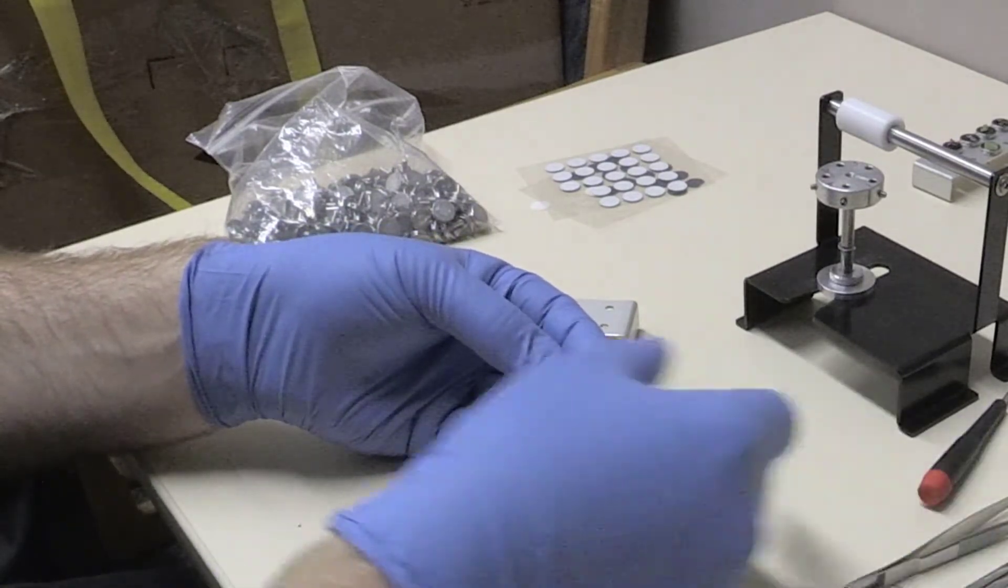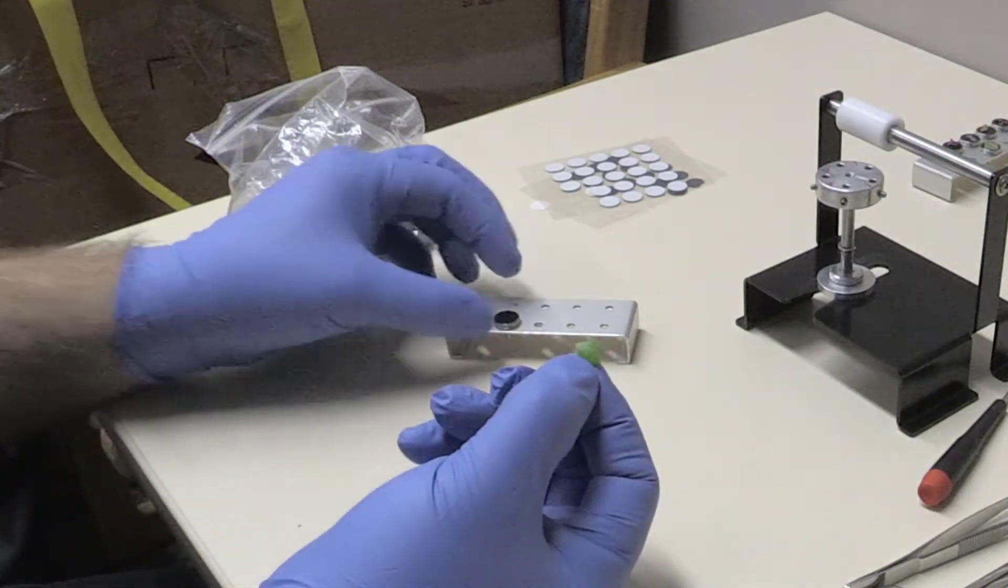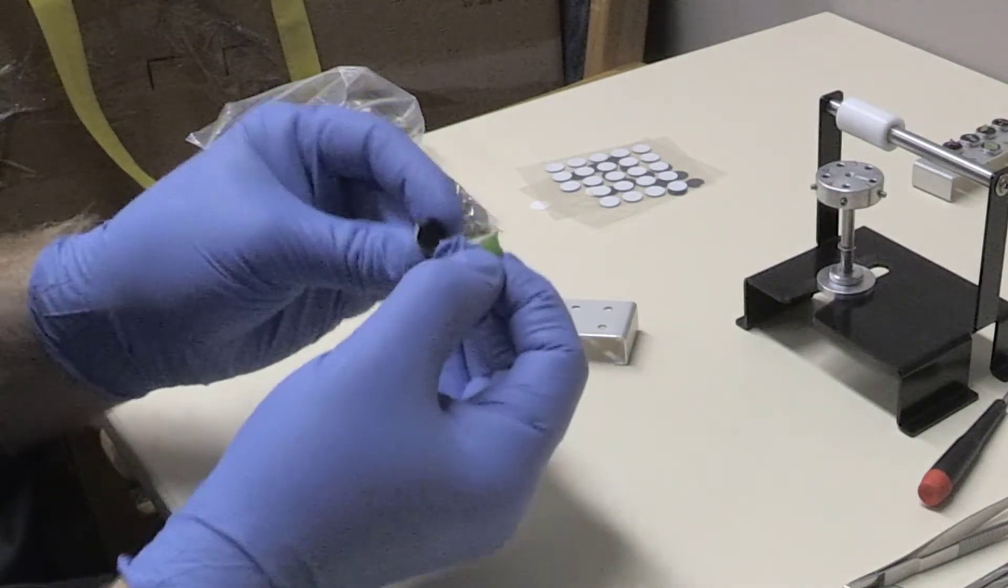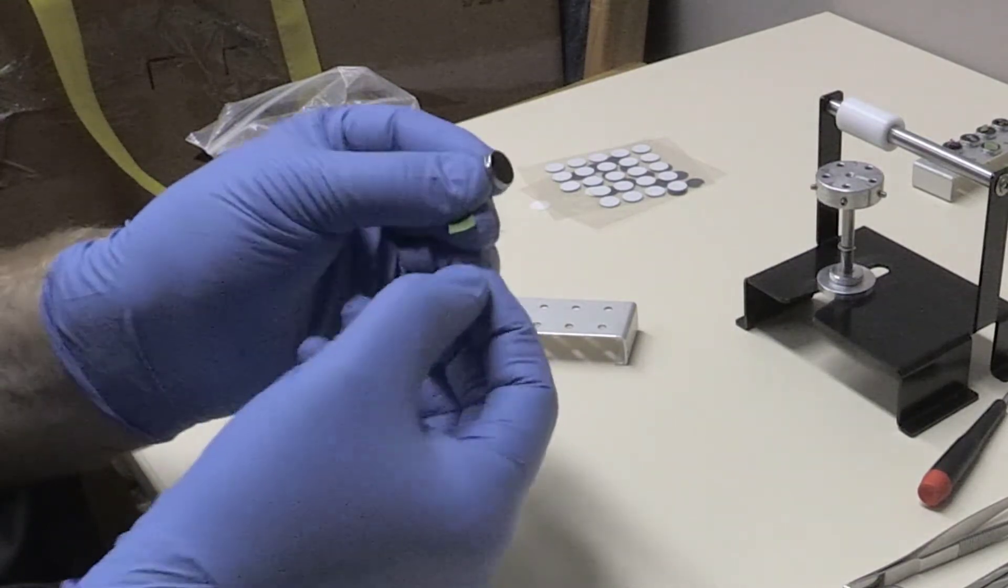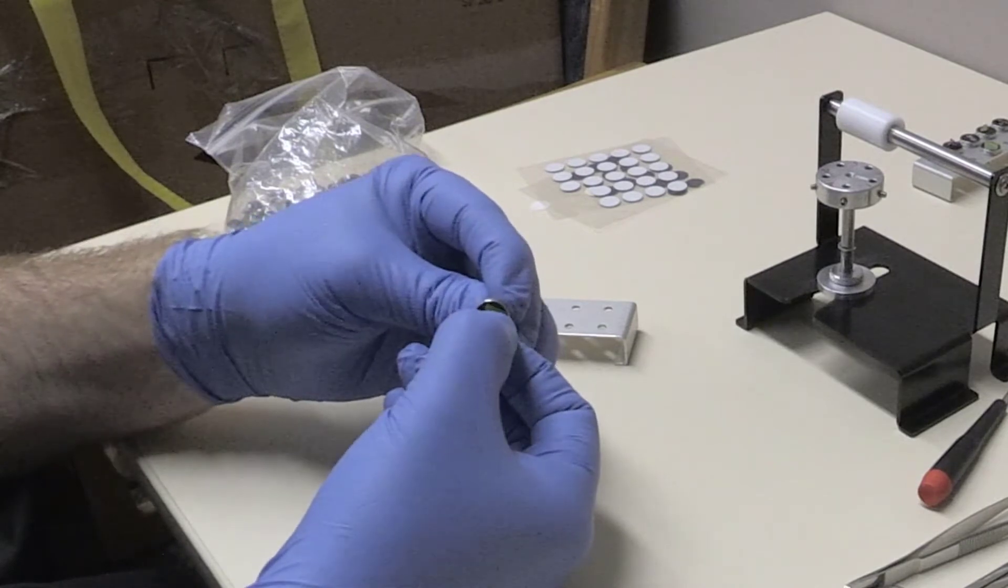Or you may have to cross section an insect. Remember that this electron microscope only sees the surface of whatever specimen you're preparing. So make sure you're putting the side of the specimen you think is most interesting or most relevant face up.